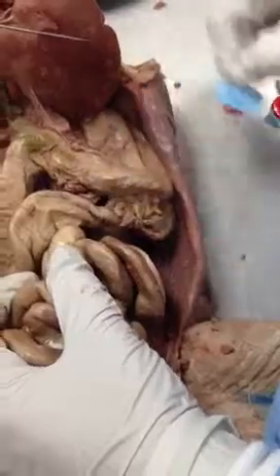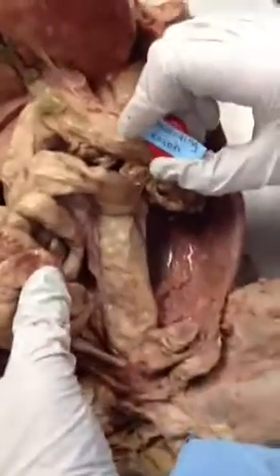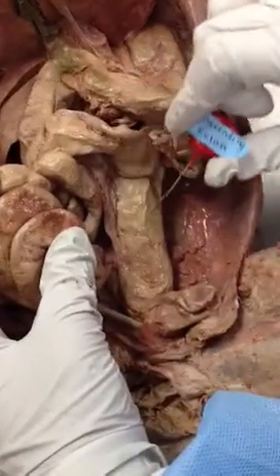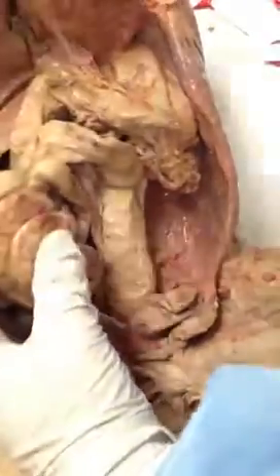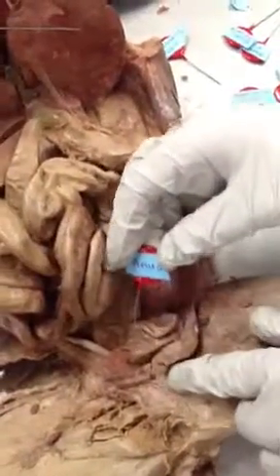And then we're going to hit the descending colon, which we have to move everything up and out of the way for. And you see it's going to go from here. We have the transverse colon, and now we have the descending colon right here. This is going to curve around to the rectum, which will eventually go down to the anus, which is going to be through this area.